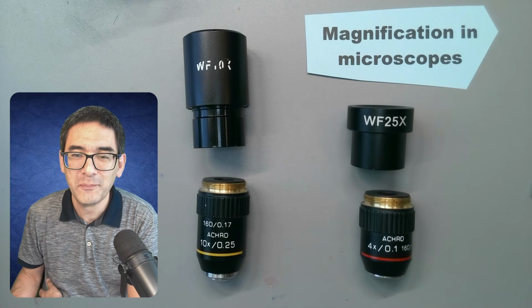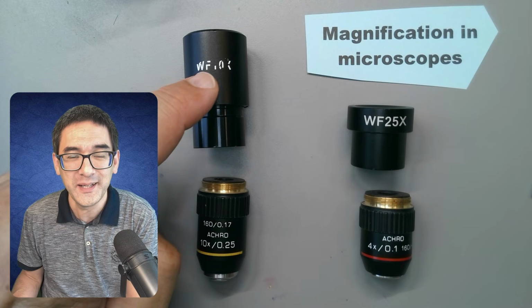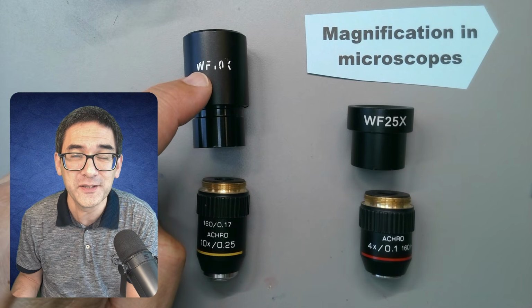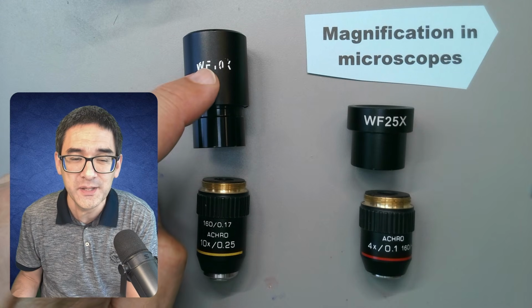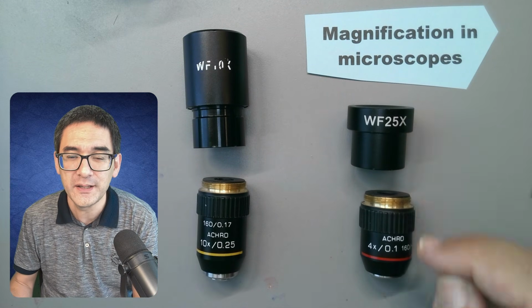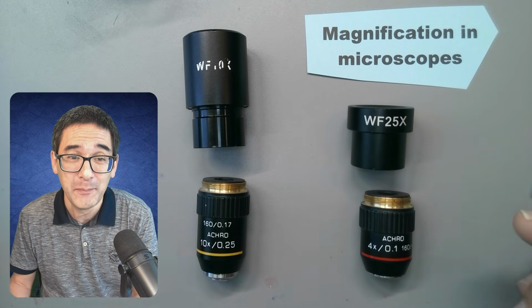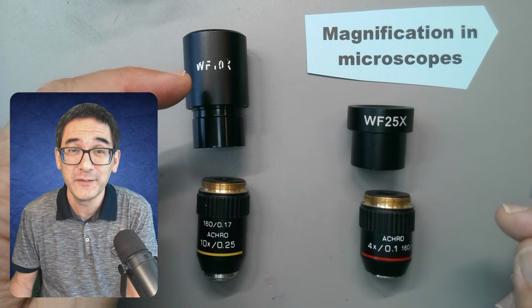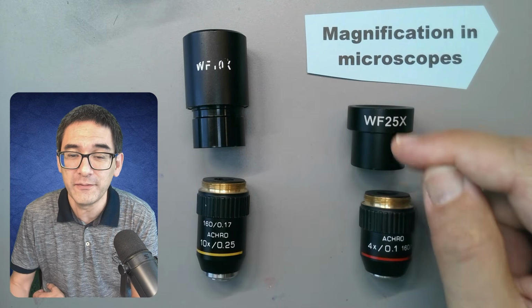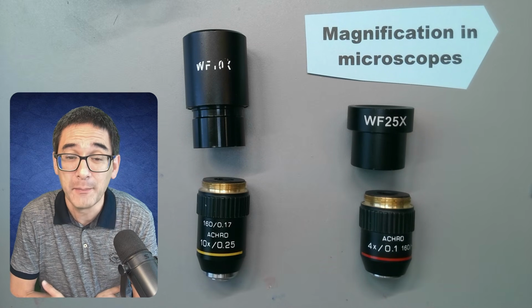So I've got two microscope objective and eyepiece combinations over here. This is a 10 times eyepiece. Unfortunately, the writing came off already a little bit. WF stands for wide field 10 times, and a 10 times objective, and over here it's a 25 times eyepiece and a 4 times objective. The total magnification is calculated quite easily by multiplying the eyepiece magnification by the objective. So 10 times 10 is 100 times, and over here 25 times 4 is also 100 times. So both of them magnify the same amount.